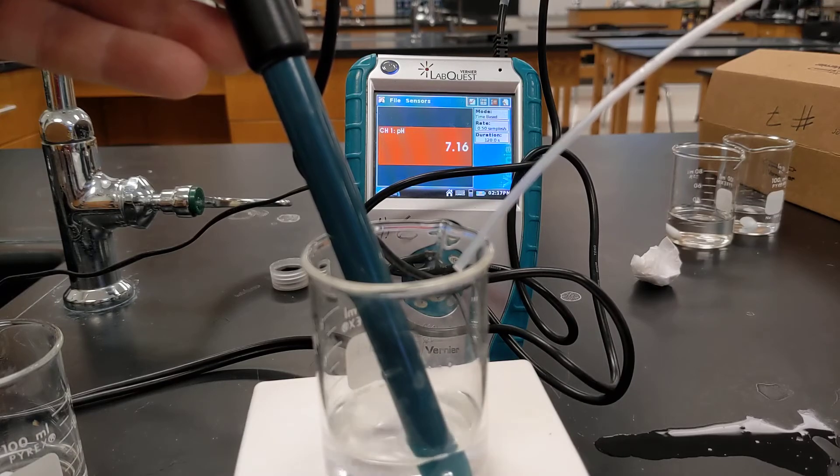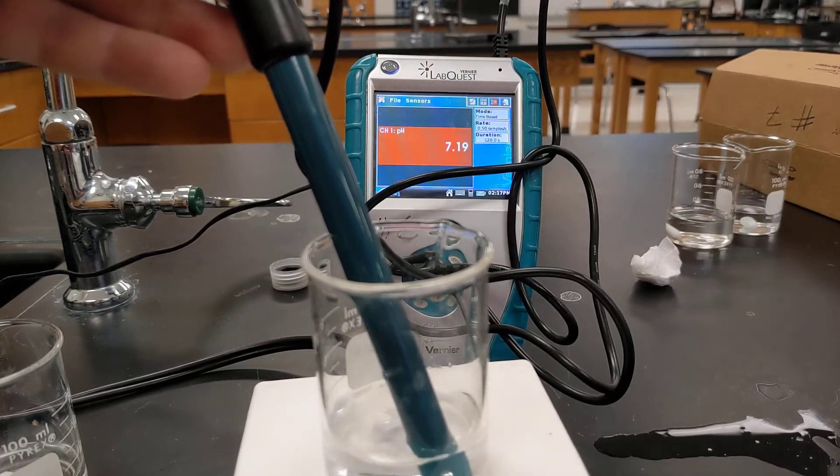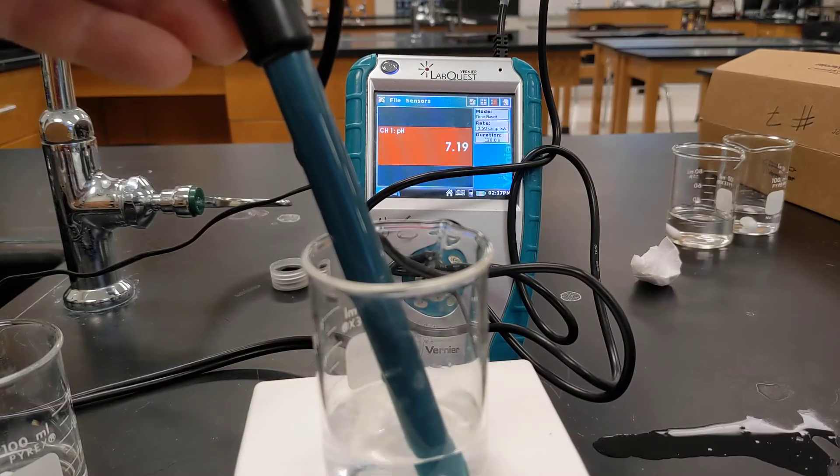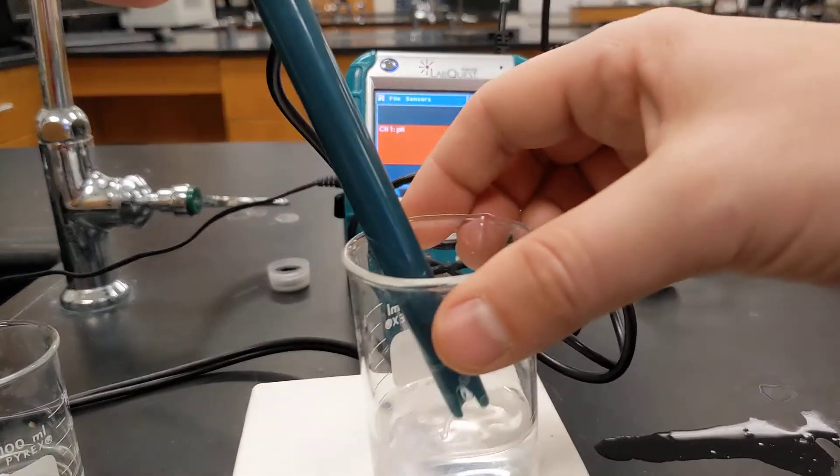We just had a whole bunch of drops. You can see the pH, although it did go up, did not go up by very much. So that's one buffer solution.